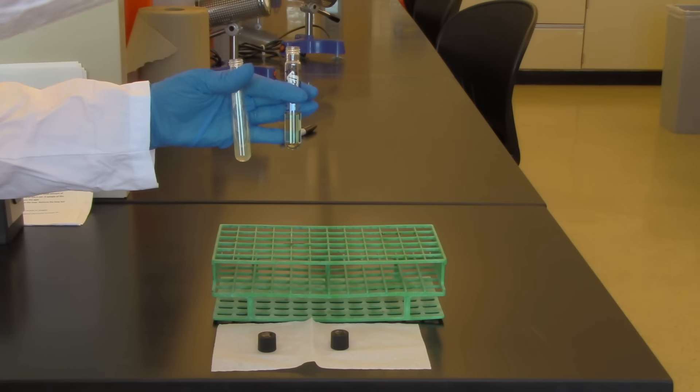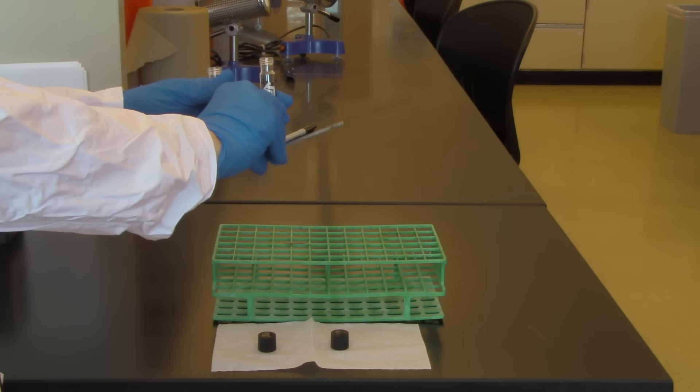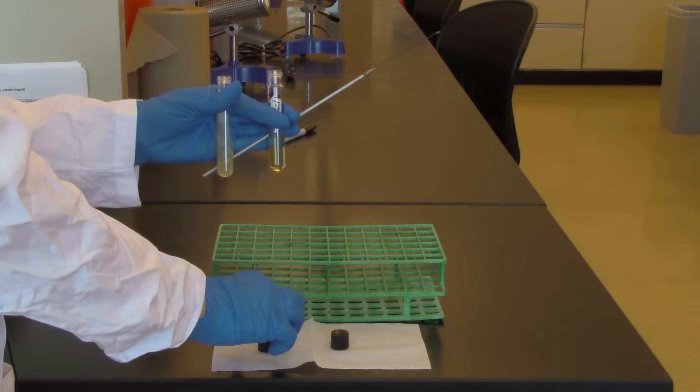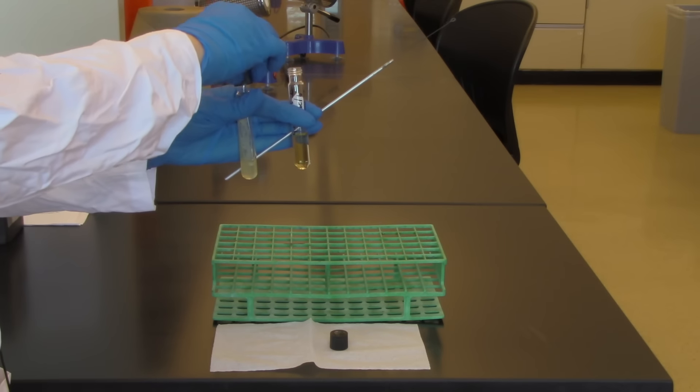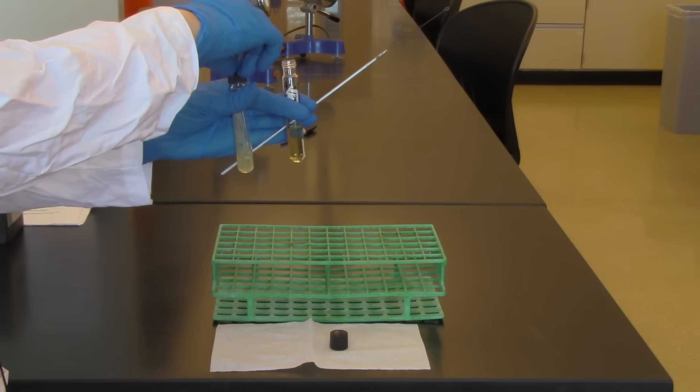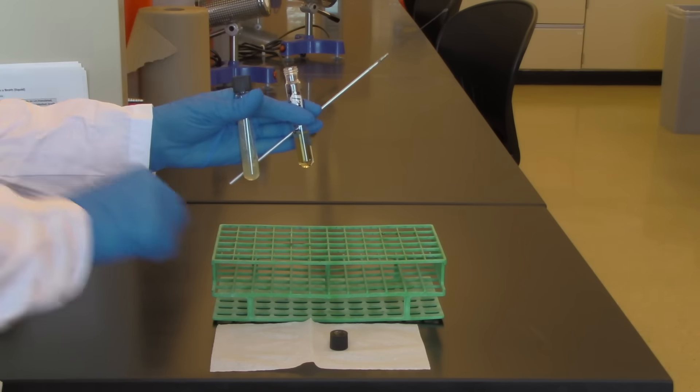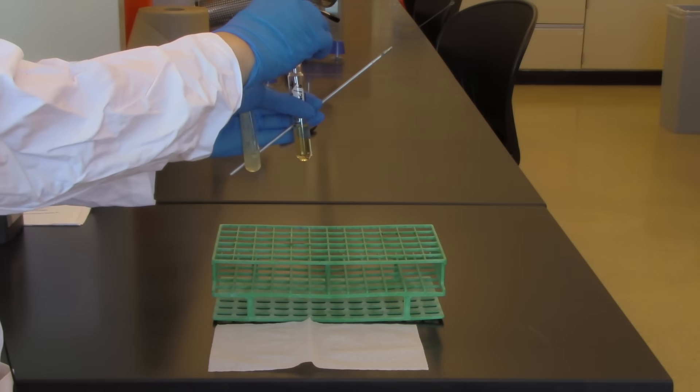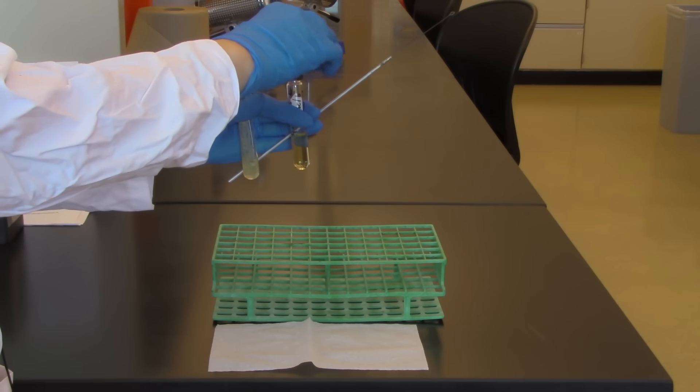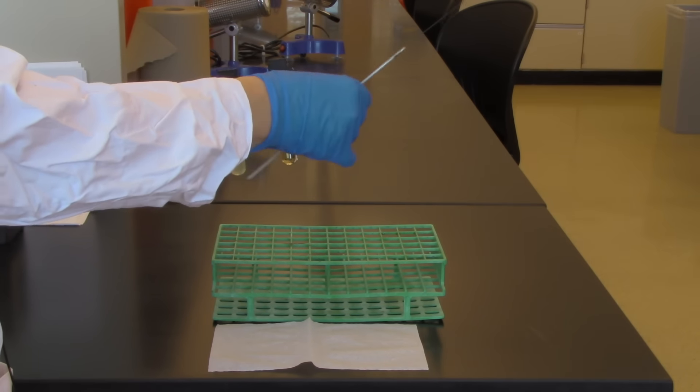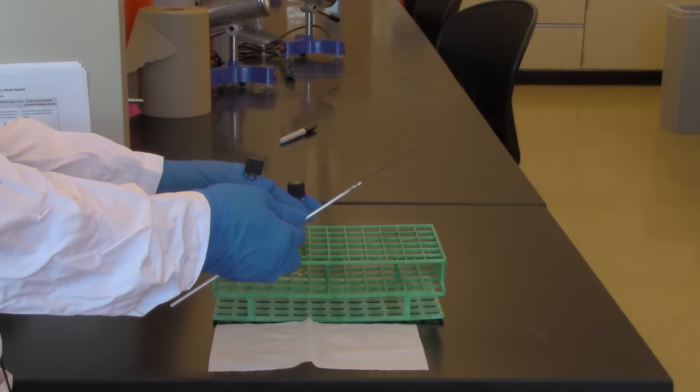I'm going to now continue to hold on to that tool and I need to put those lids back on. I'm going to pick up the lid from my starting culture, put that on, and then I'm going to pick up the lid from my newly inoculated medium and then place those into my rack.